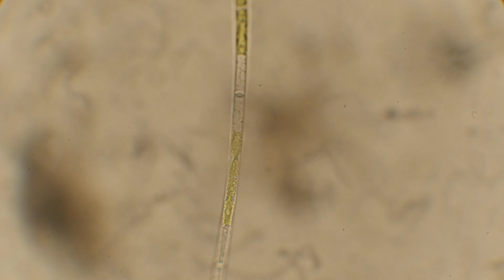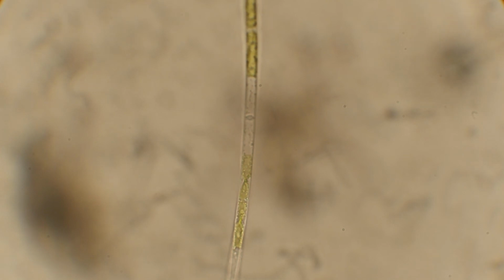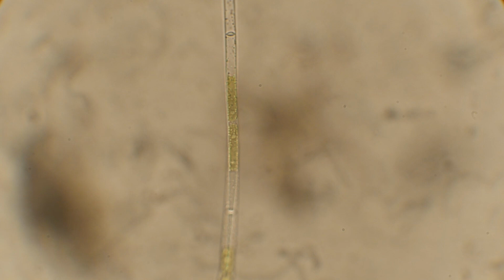So I'm interested to hear your feelings about this. People who are interested in optics, microscope optics, the business of especially Olympus, and the business of shortening the optics from the OEM Olympus photo tube, the one that originally came with this microscope, the BH2BHS, to the MTV3, which is significantly shorter and has an additional lens in it. So, what is that? Interesting. So, algae always has so many surprises. Okay. Thank you very much.